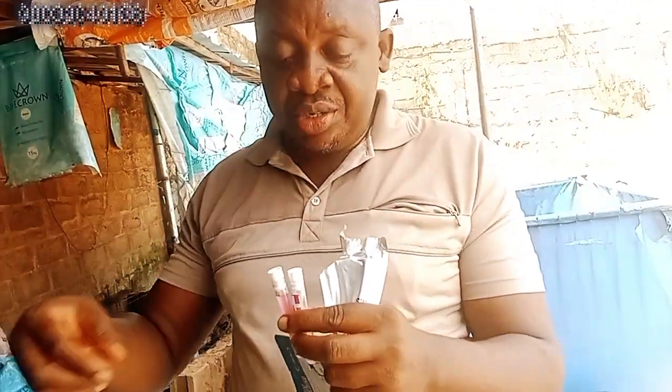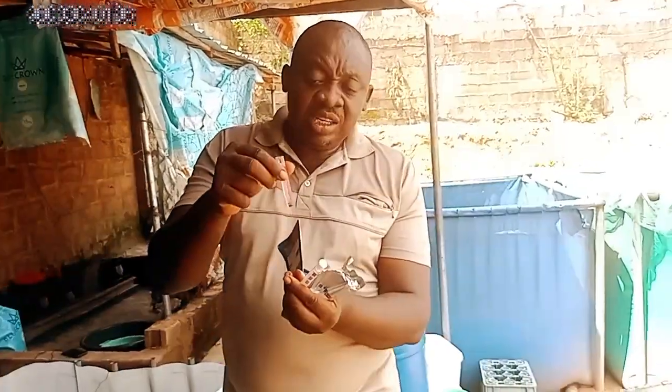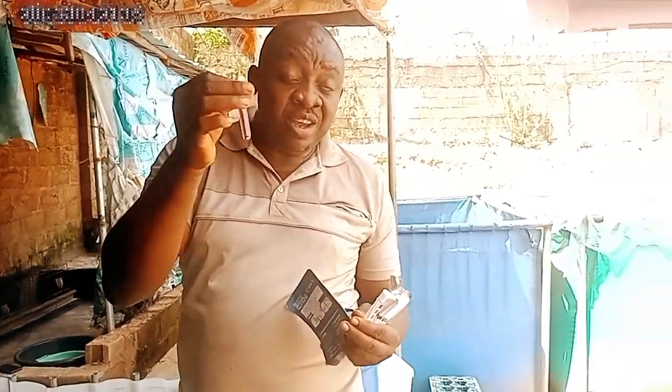The water you want to use for your hatchery, it is advisable to just open this like this. As you open it, you put water inside to this level. Once you put the water to this level, you have to cover it up. Once it is covered, leave it for 15 to 20 minutes. You can leave it for 25 to 30 minutes. It doesn't matter. Just leave it there, and this will tell you the level of nitrate in your water.